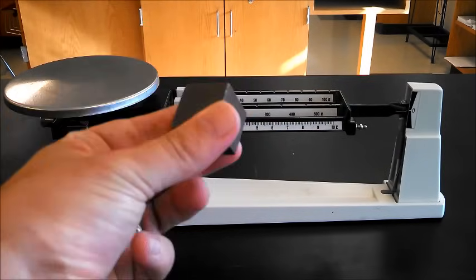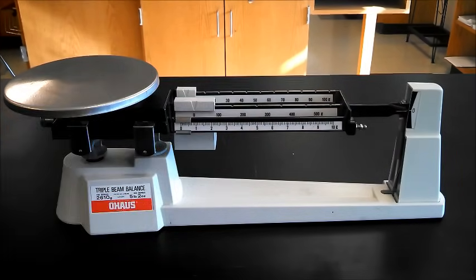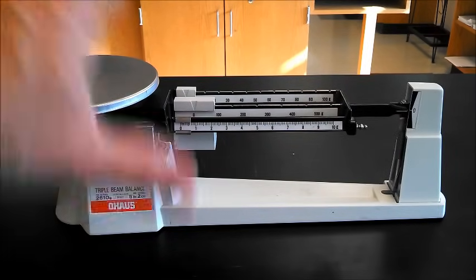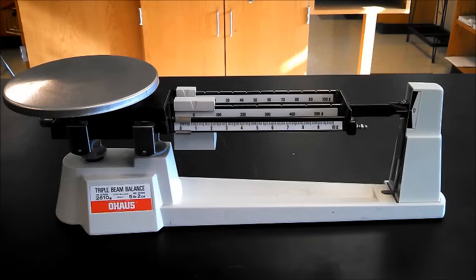Today, we're going to find the mass of this iron cube. To begin with, let's go over some of the features of the triple beam balance.